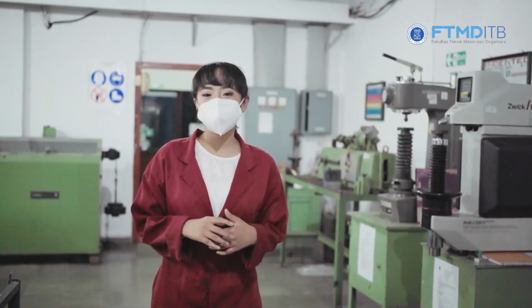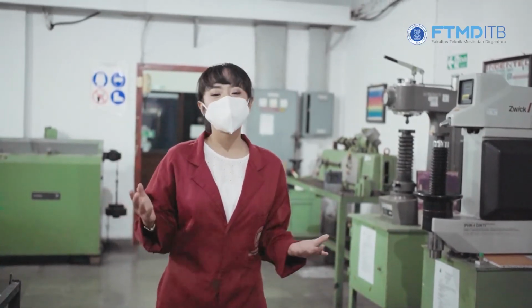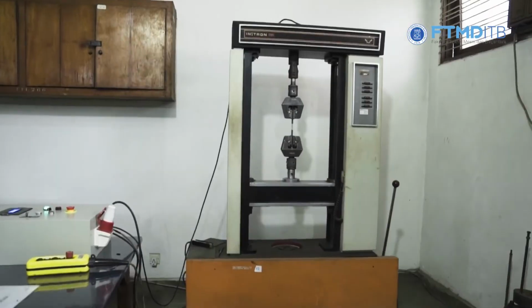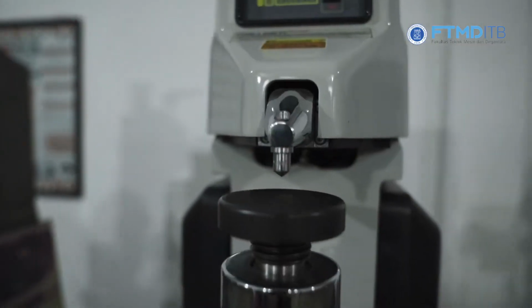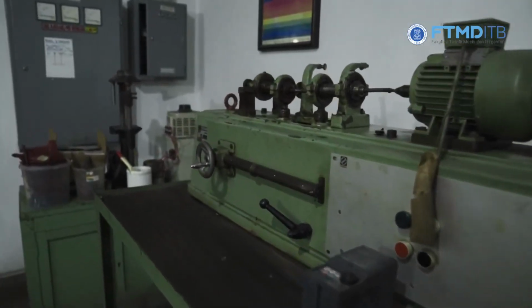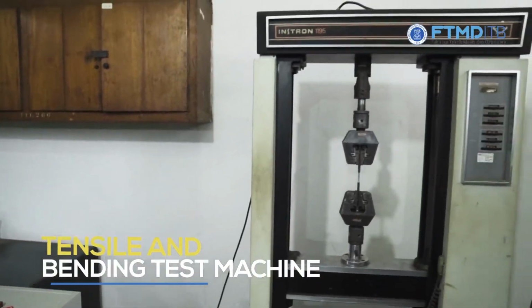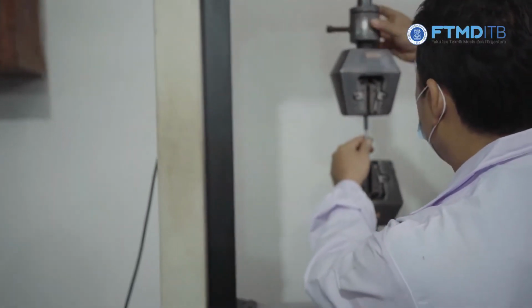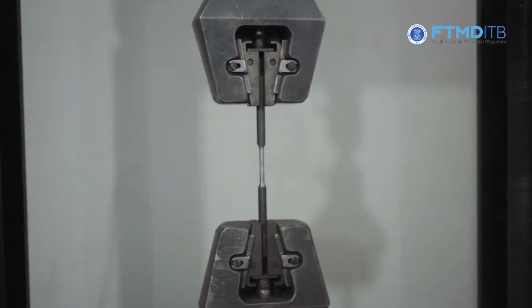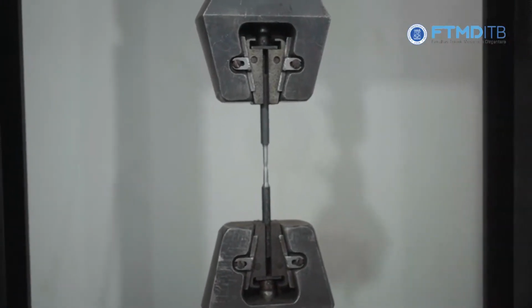Here, we have several machines to characterize mechanical properties of materials such as tensile or bending test machine, hardness test machine, torsion test machine, fatigue test machine, and also impact test machine. This is the tensile or bending test machine used for testing mechanical properties of materials such as flexural strength, modulus of elasticity, elongation, and tensile strength.